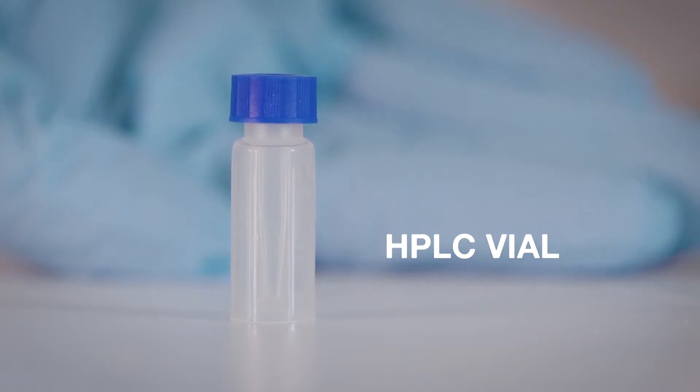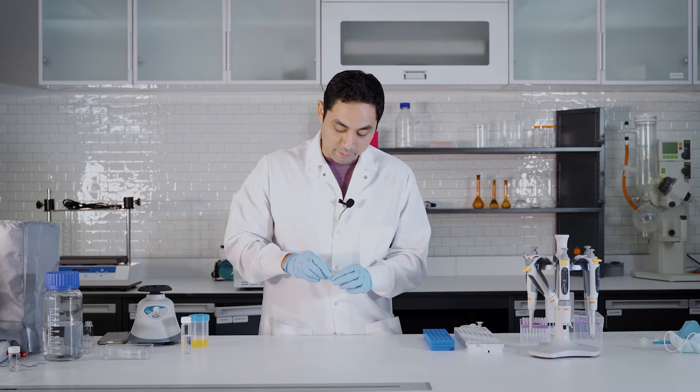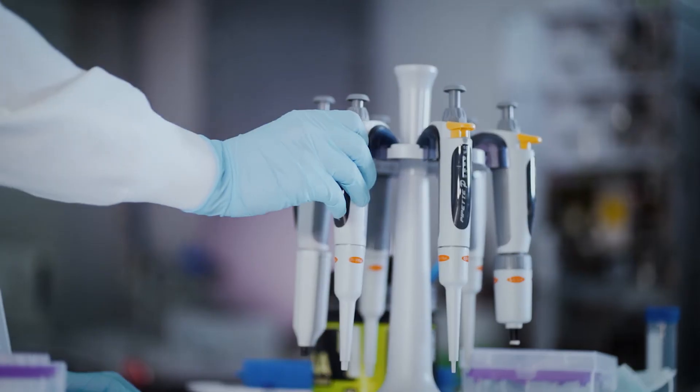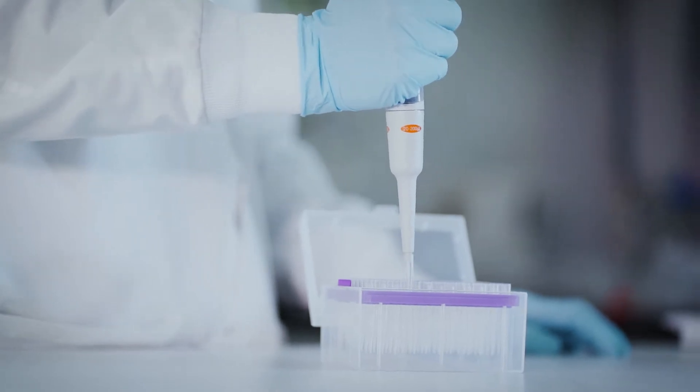We got our HPLC vial here. Here I'm using a limited volume vial just because I don't have that much supernatant. So I'm gonna get my pipette tip. 200 microliters. Take that.